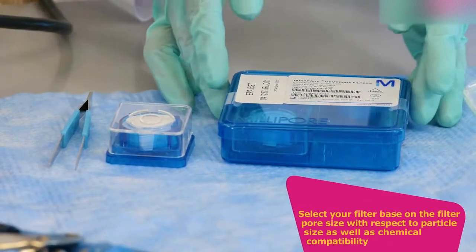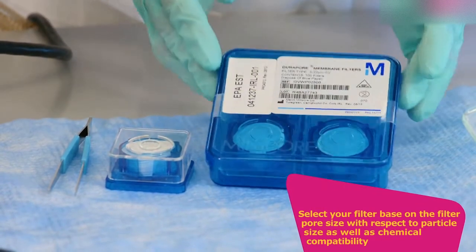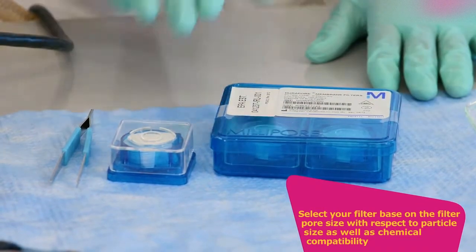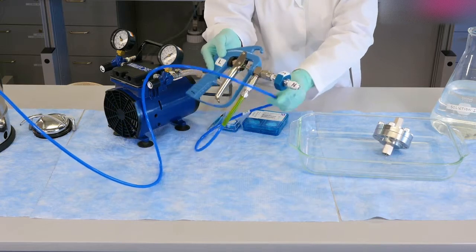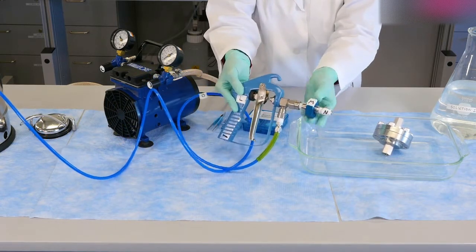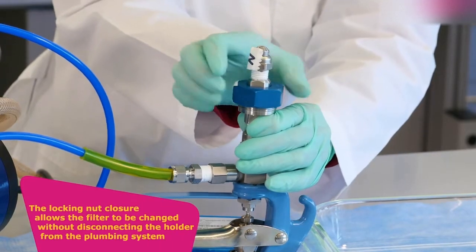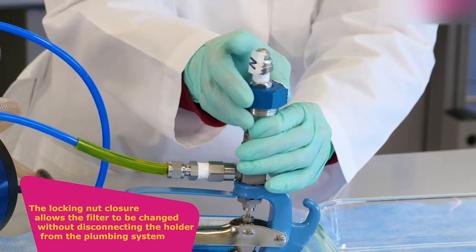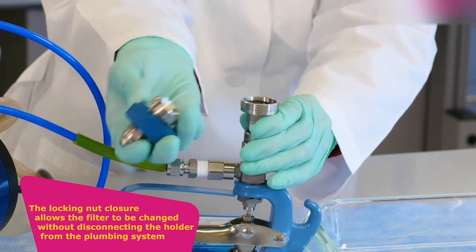Select your filter based on the filter pore size with respect to particle size as well as chemical compatibility. The locking nut closure allows the filter to be changed without disconnecting the holder from the plumbing system.